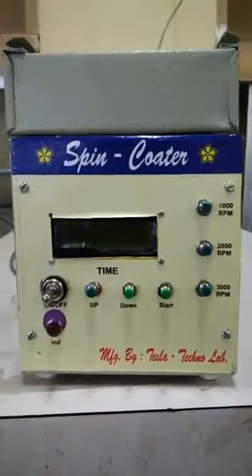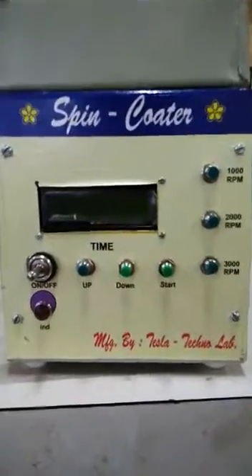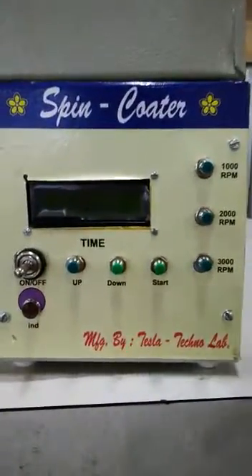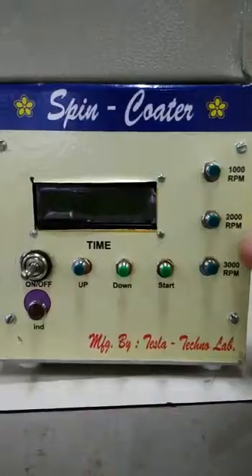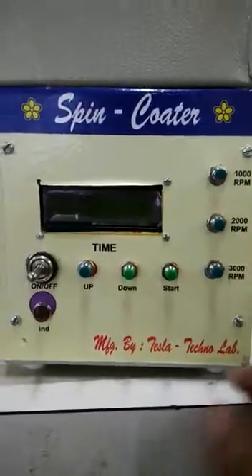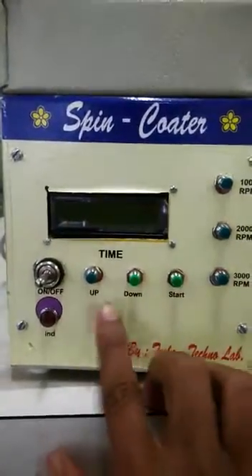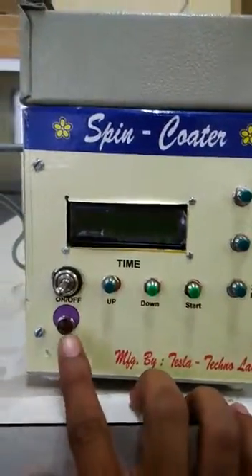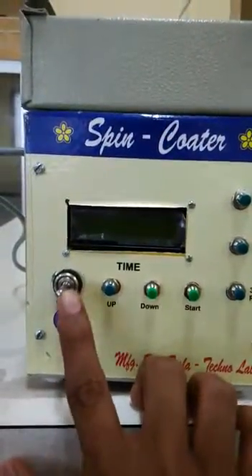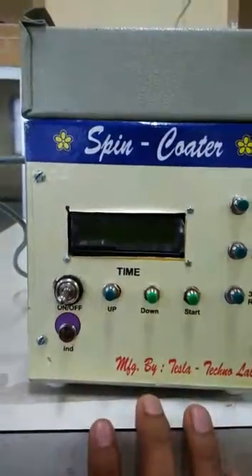This is the front panel of the spin coater where you can see the buttons for RPM selection and buttons for timing selection. There is also a small indicator and a switch.